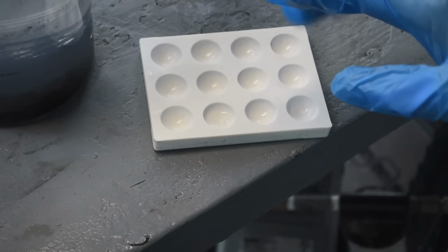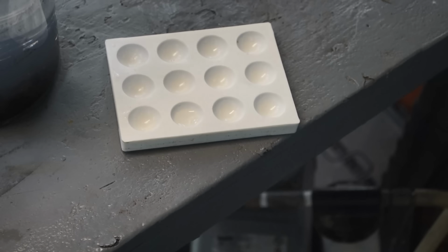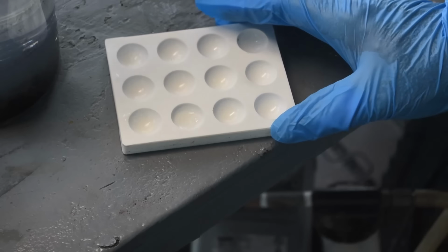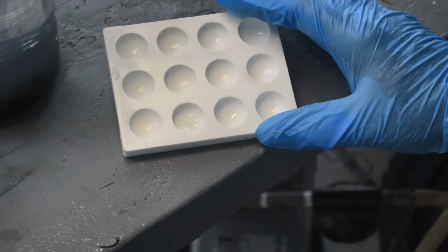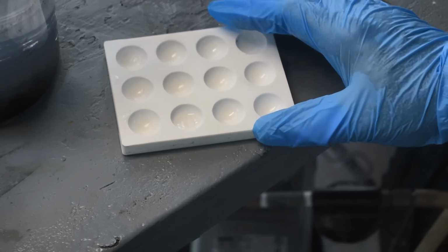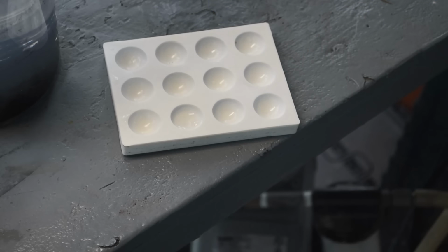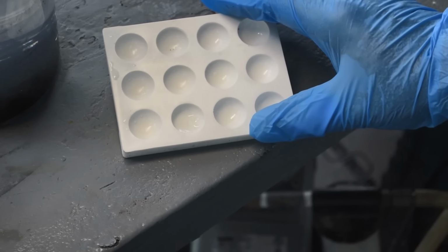Yeah, there might be a little bit of rhodium in this liquid here. And rhodium is like the most expensive of the platinum group metals. But boy, that is very, very faint pink. Certainly, there's not more than just a tiny fraction of a gram in this liquid, I'm sure. Probably even less than that. That's very, very pale pink.